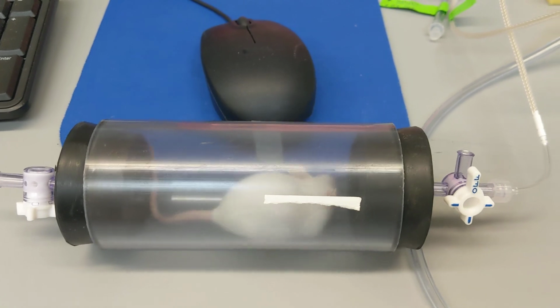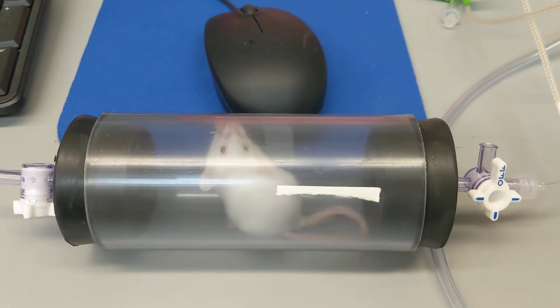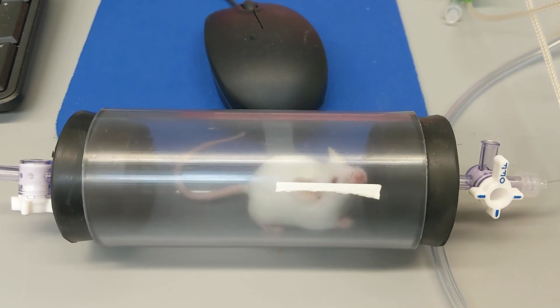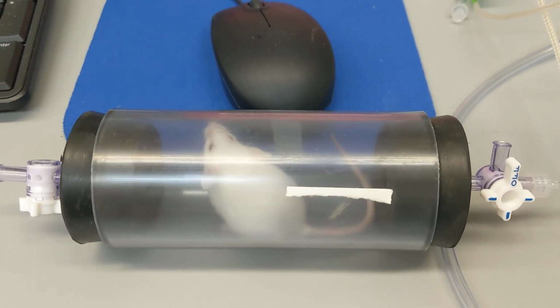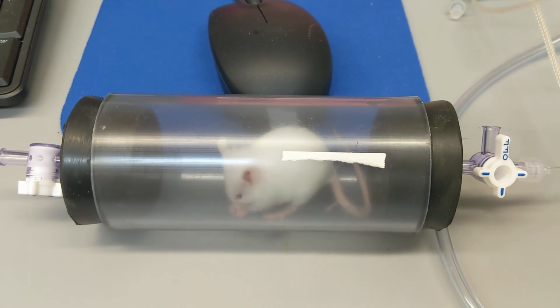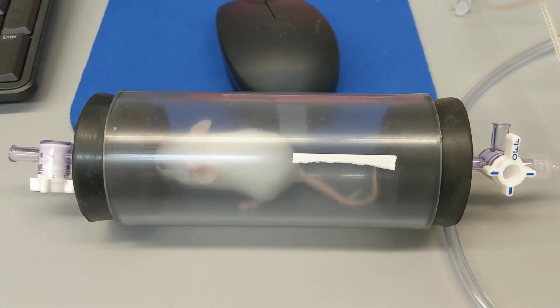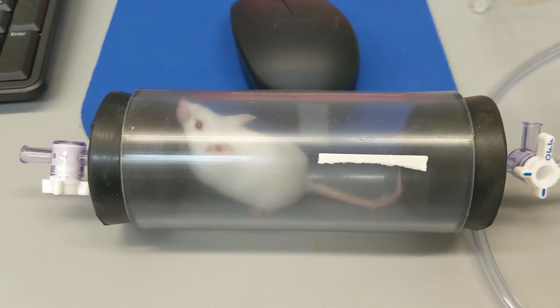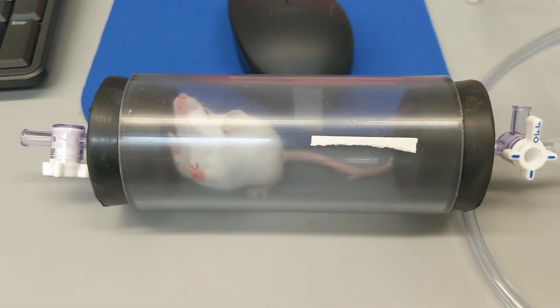What we'd be really interested in measuring, and the data that I'm going to collect for you here in a little bit, is the resting metabolic rate of the animal. So looking at this animal as it's acclimated and rested to this. So remember previously with our other scenario where we had the values at 20.94.